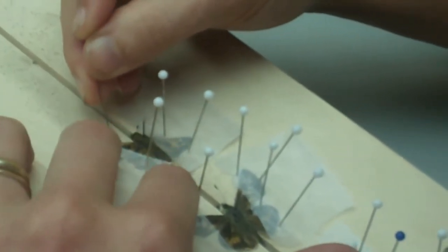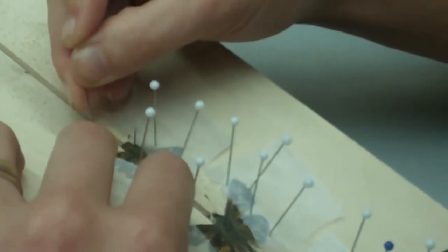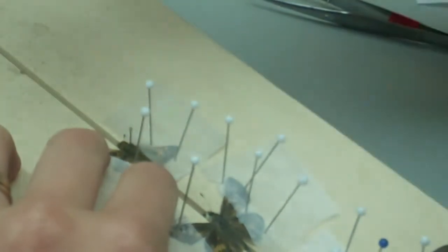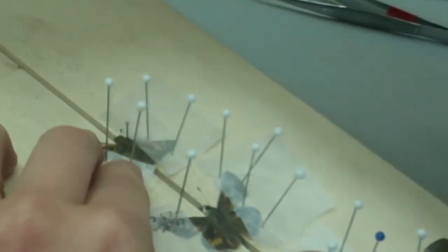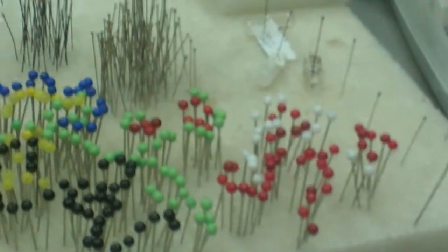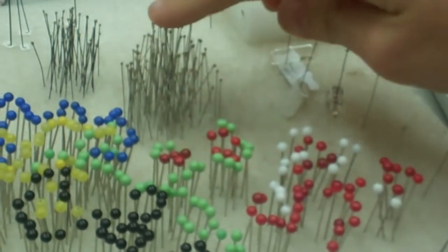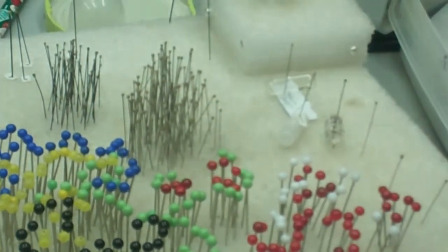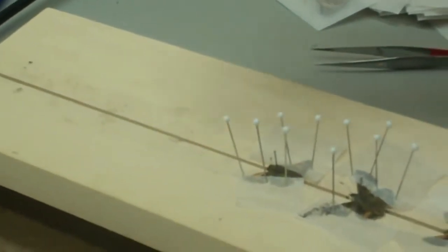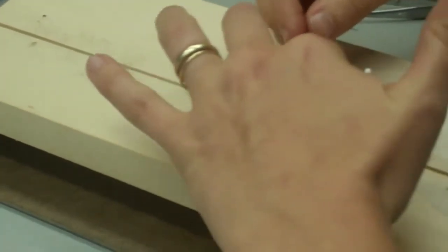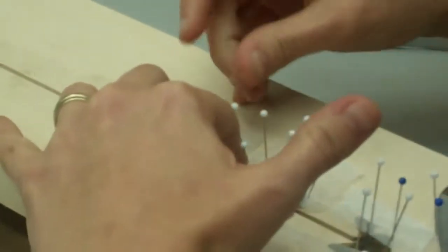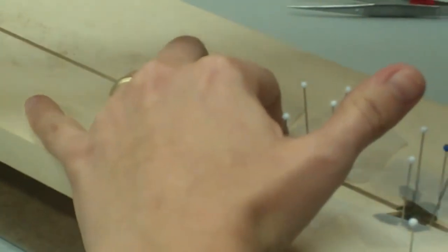And do my best to stabilize the wing. Move it just a little bit at a time. And your tools, they're pins. These are the pins. These are just sewing pins. These right here. These are insect pins. Very flexible, lightweight insect pins. And these are old envelopes that we've cut up to position the wings. And this is a spreading board that you can buy through biological supply companies. But you can also make one. There are plans online for you to make one. But I like these much better. They're made out of foam and balsa wood, basically.